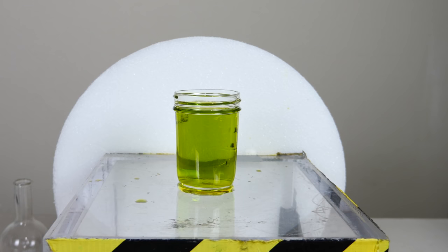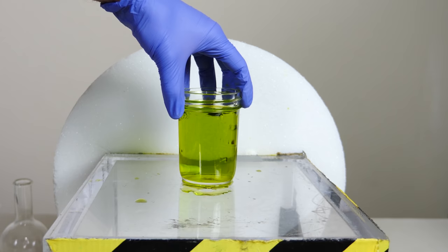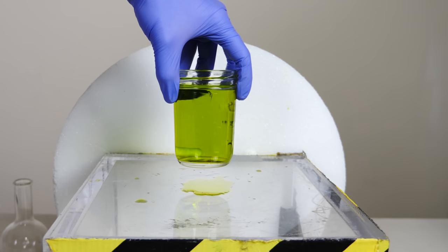So notice how much longer it's staying green now, when I actually bubbled oxygen through it. When I just shook it, it didn't stay green for that long. But look how long it's staying green now.